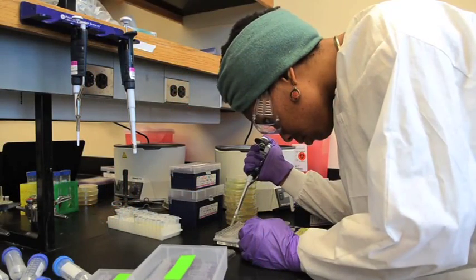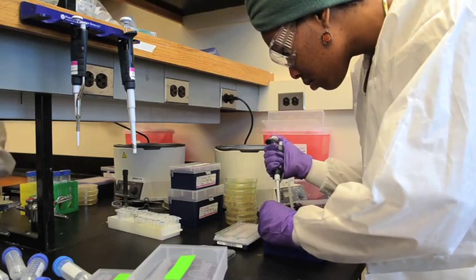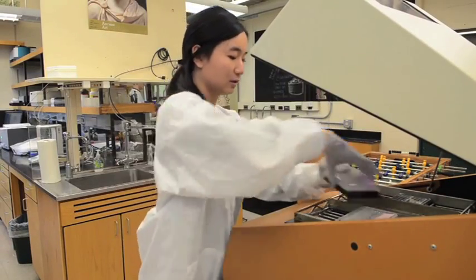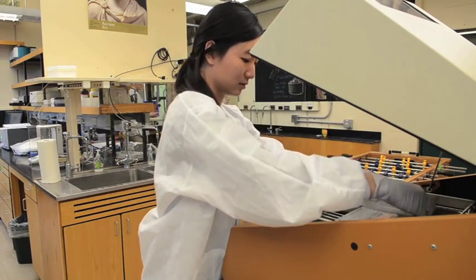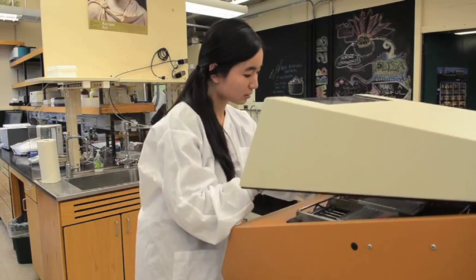Class centered on a particular technology which is called phage display, and the easiest way to think about phage display is first to understand that phage is just a virus, but it's a virus that attacks bacteria, not us, so the students were safe. And the second thing is that because they're such simple things, we can co-opt their DNA, and in fact what gets generated are phage that are each a little bit different. So a single tube of phage actually has a billion or a trillion rather different virus particles in it, and you can think about these like antibodies.